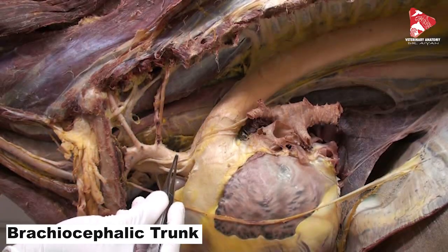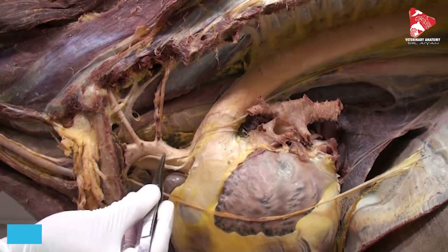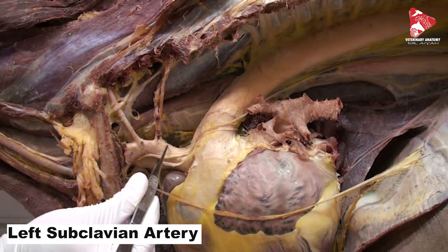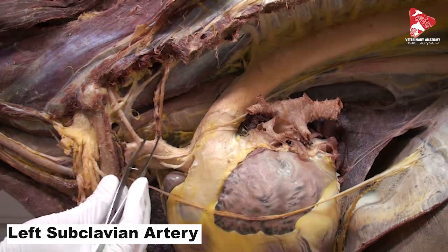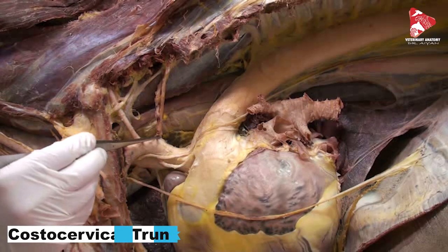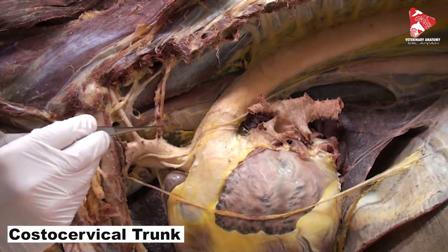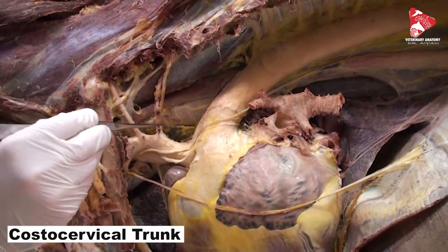The first branch from the aorta is the brachiocephalic trunk, which gives both the left and right subclavian arteries. Here we can see the left subclavian artery, from which the first branch is called the costocervical trunk.